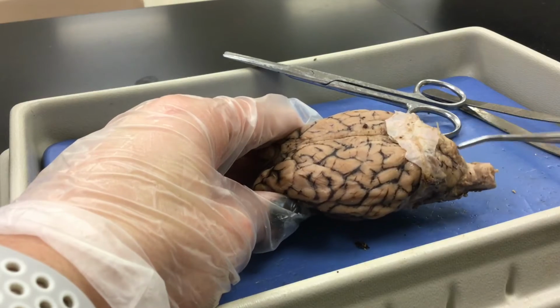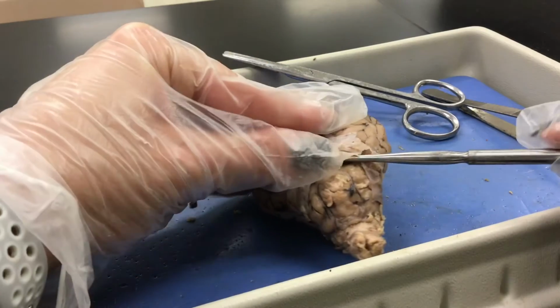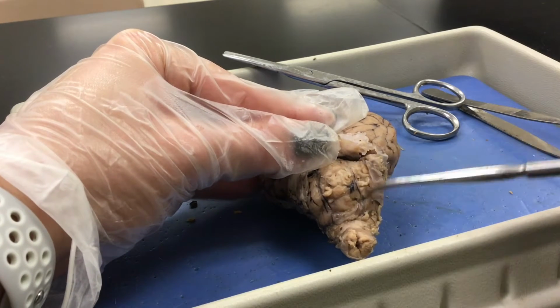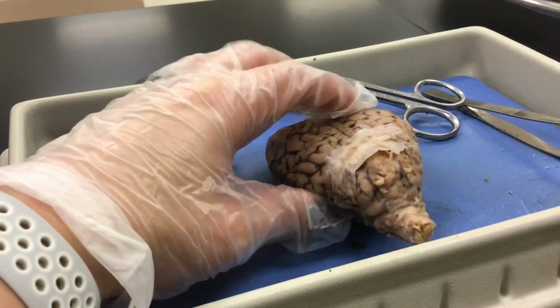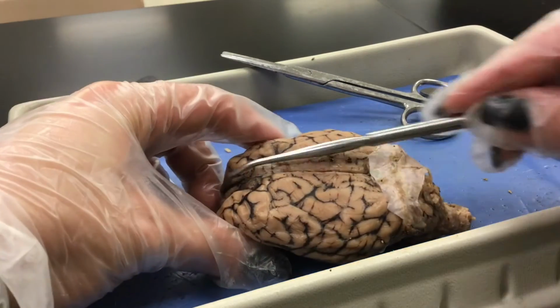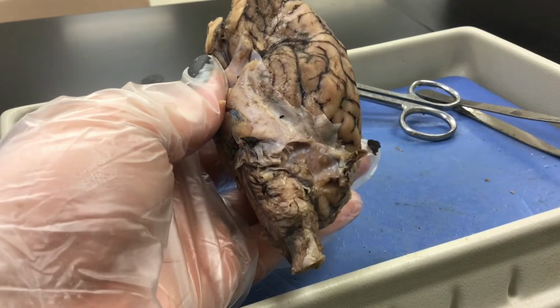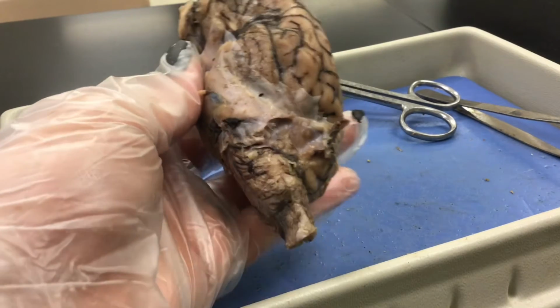We also have the cerebellum. Not sure if you can see it. The cerebellum is back here. And I can tell because it has a clear difference between the cerebrum and this section, the cerebellum. Then we have the brainstem. So we're going to dive in here. I'm going to make a cut down the longitudinal fissure so we can see the inside of the brain. Here are some other external features that are probably easier to see once we dive in, but I want to make sure we go over them.